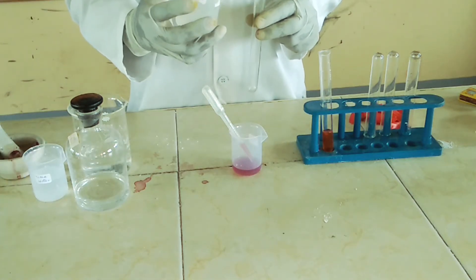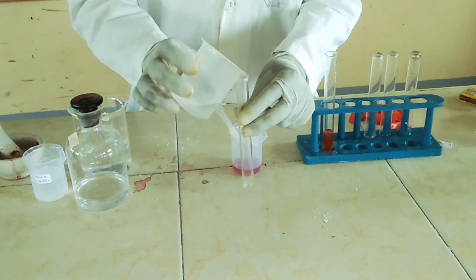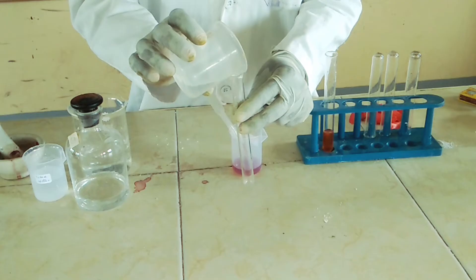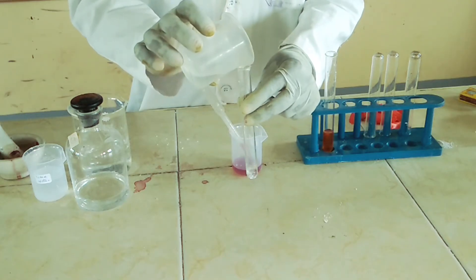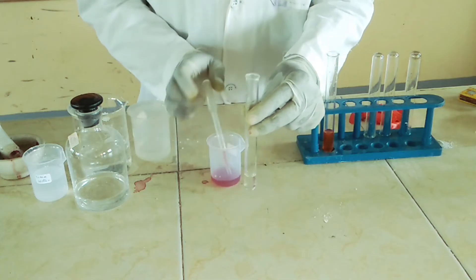Let us test also a base using the same indicator. So I'm going to test sodium hydroxide. Just put some small amount of sodium hydroxide into a test tube, around 10 centimeters cubed.